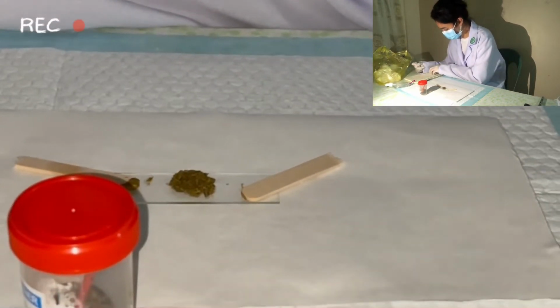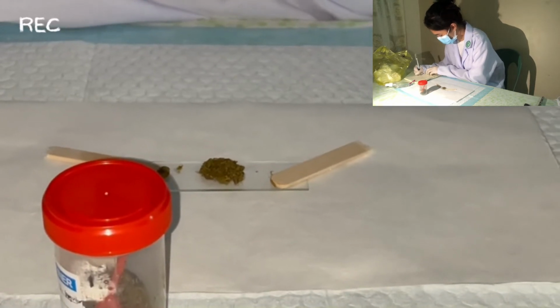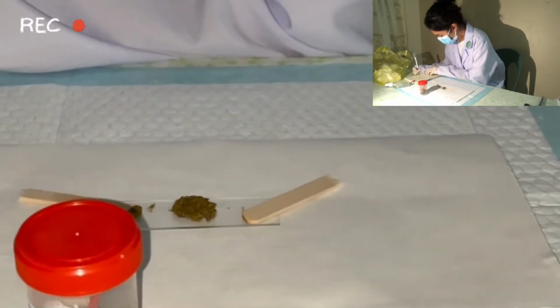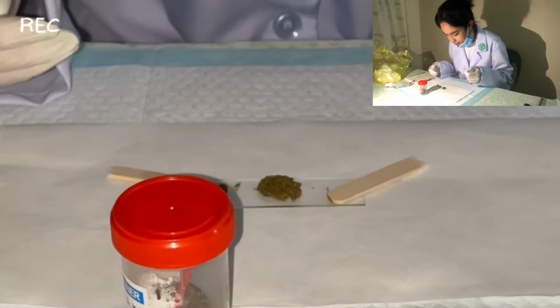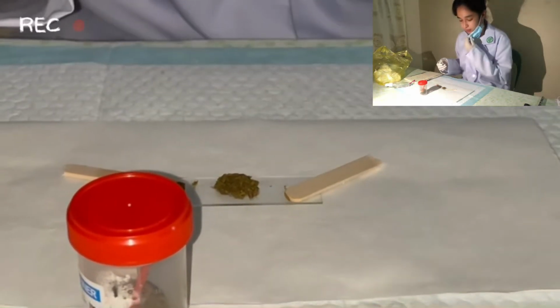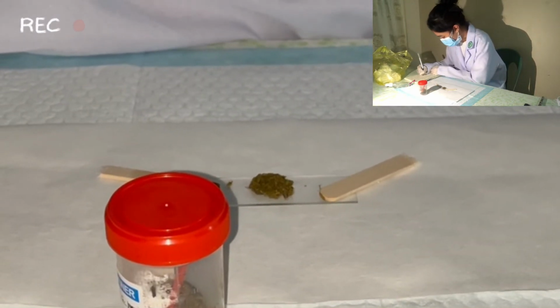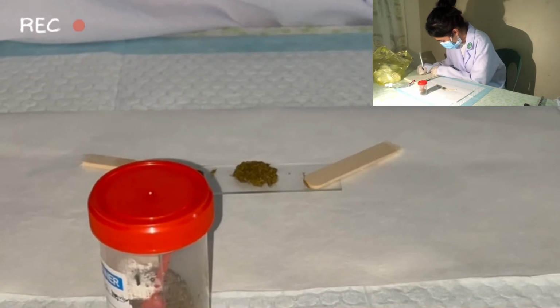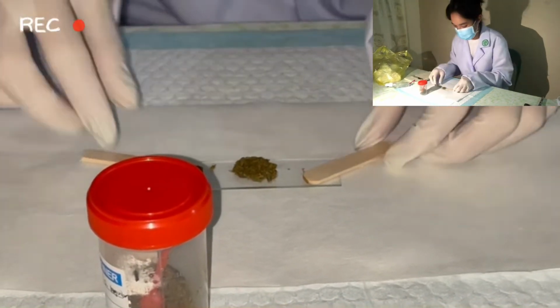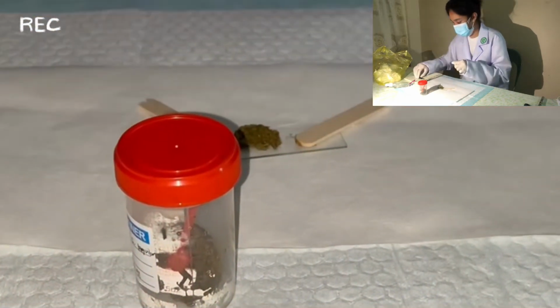The color of the stool that I examined is brown, which is normal because poop is naturally brown due to the bile produced in our liver. Then, the odor that I observed is just the normal odor of stool. Basically, the odor depends on the pH of the stool. Indole and skatole are the substances that produce the normal odor, formed by intestinal bacterial fermentation and putrefaction.